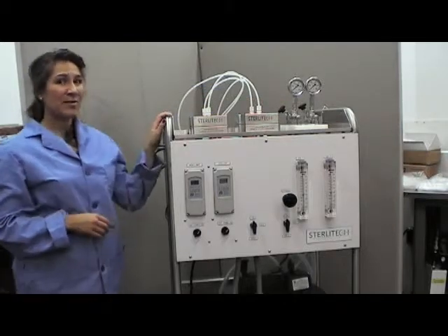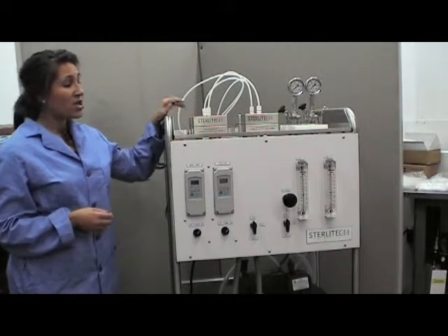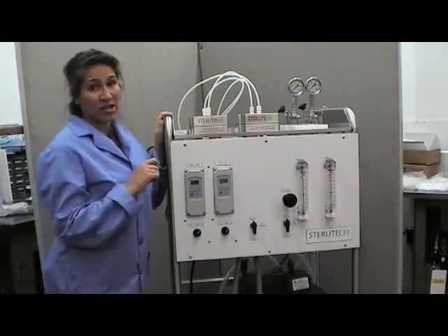For the purpose of this demonstration we're going to try setting the system to 300 psi and we're only going to utilize line one. So to start we can begin by turning line two off.